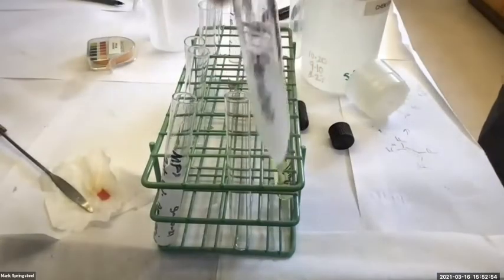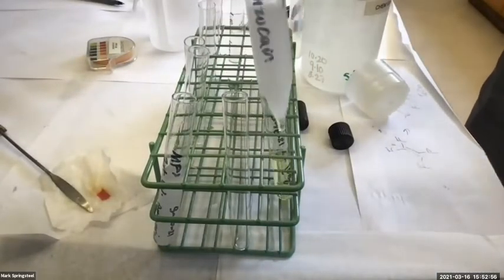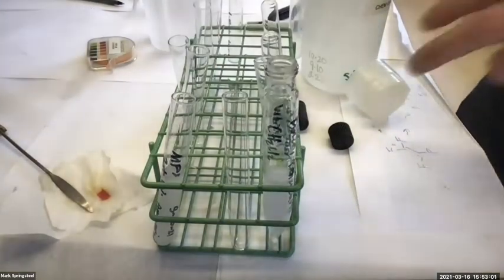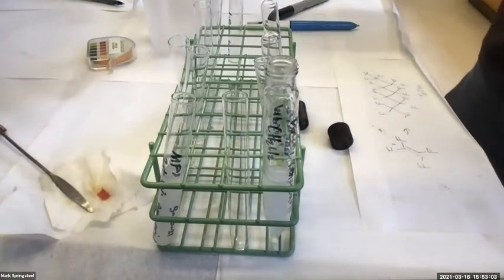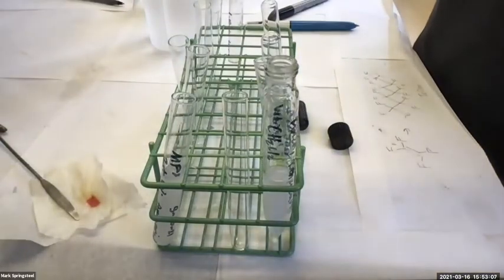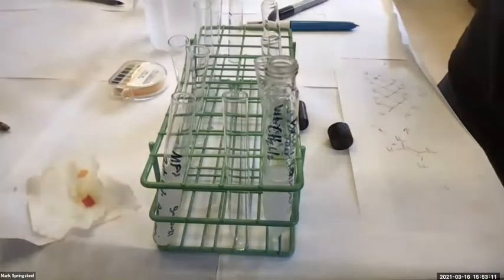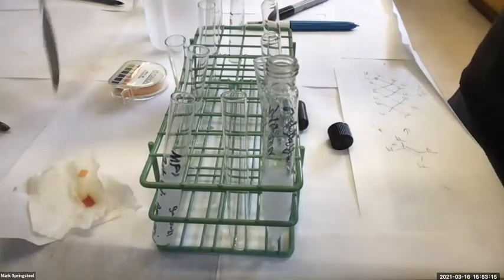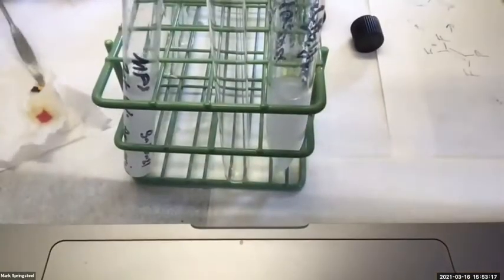Yeah, it's starting to get cloudy, see it? Nice and cloudy again. Oh, I left a little organic in there. That was not the best. Experimental error. Oh, well. Let's check that pH as well. We've got to make sure we made it basic. Otherwise, we're going to get a bad yield of our precipitate. So I'll put my spatula in there, swirl it around. Check the pH paper. Yeah, that's basic.